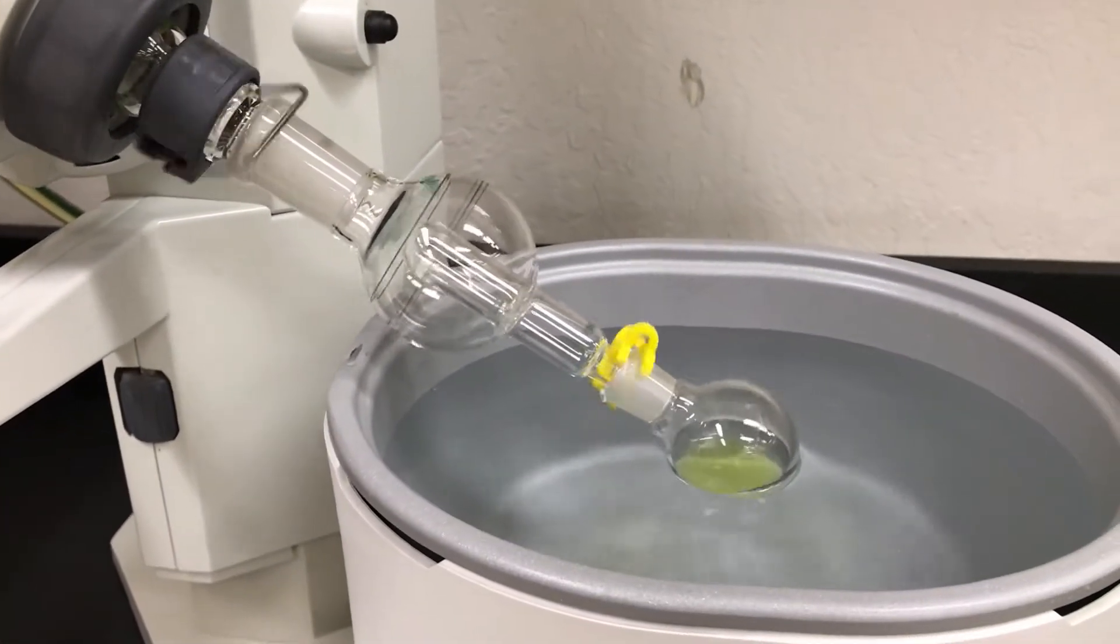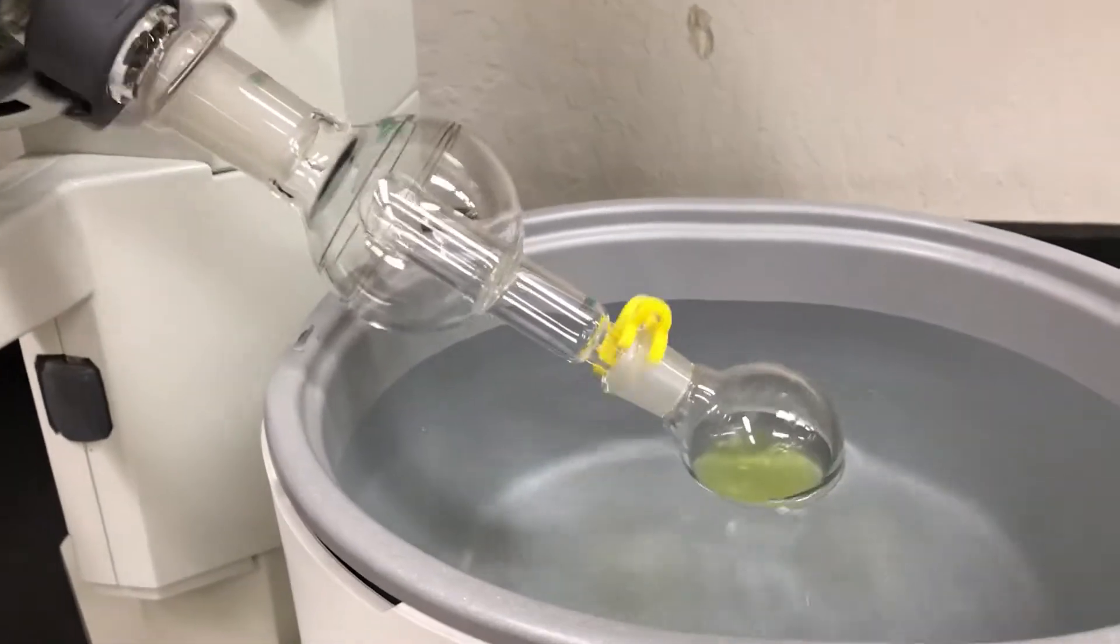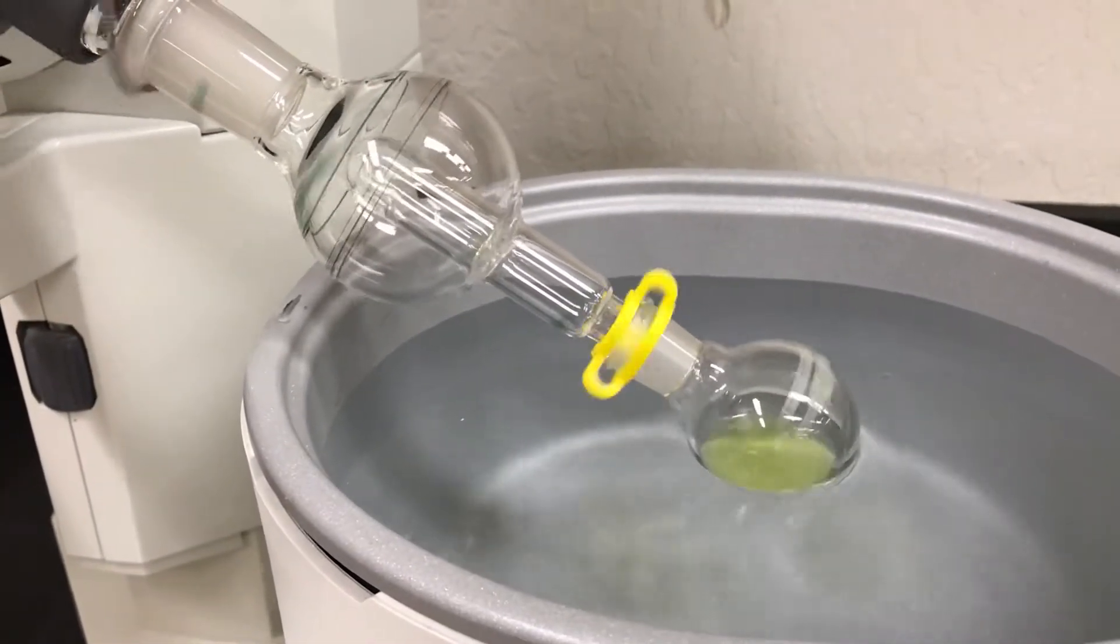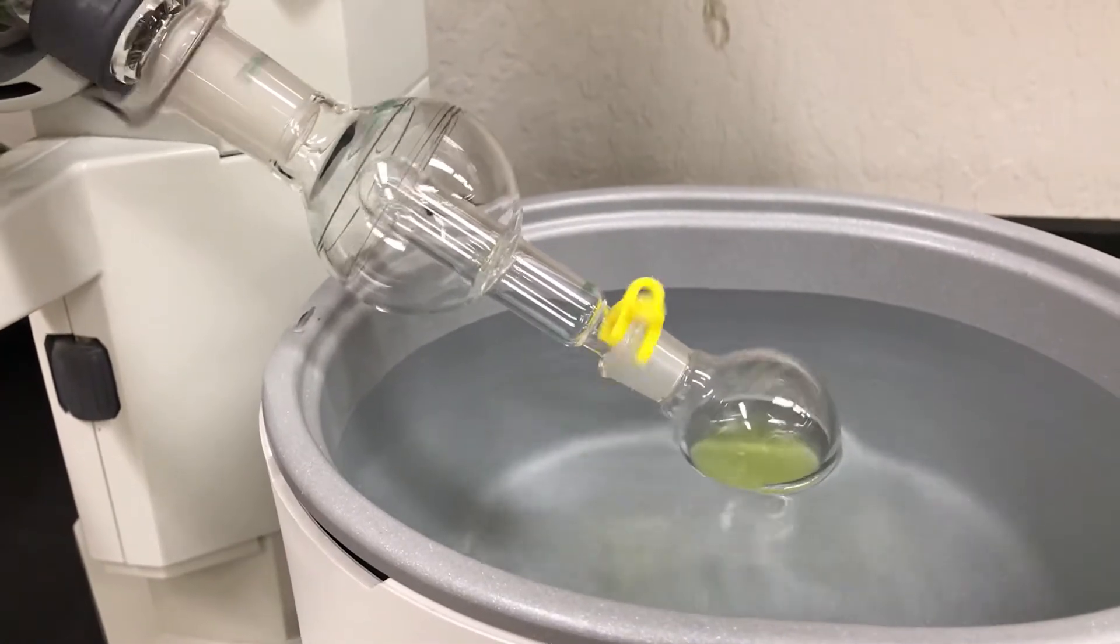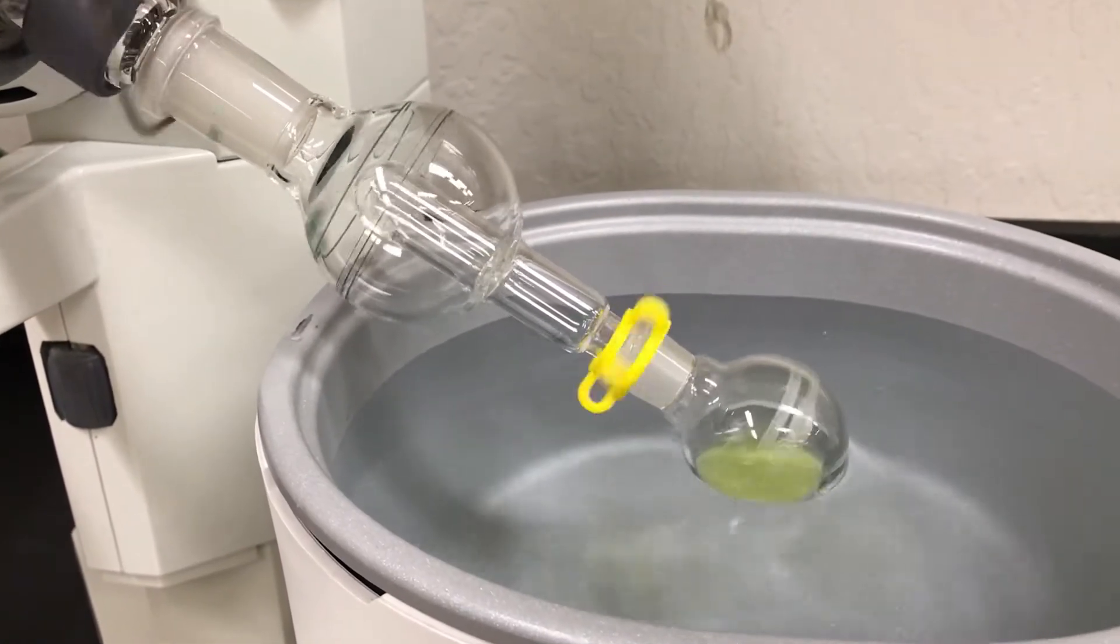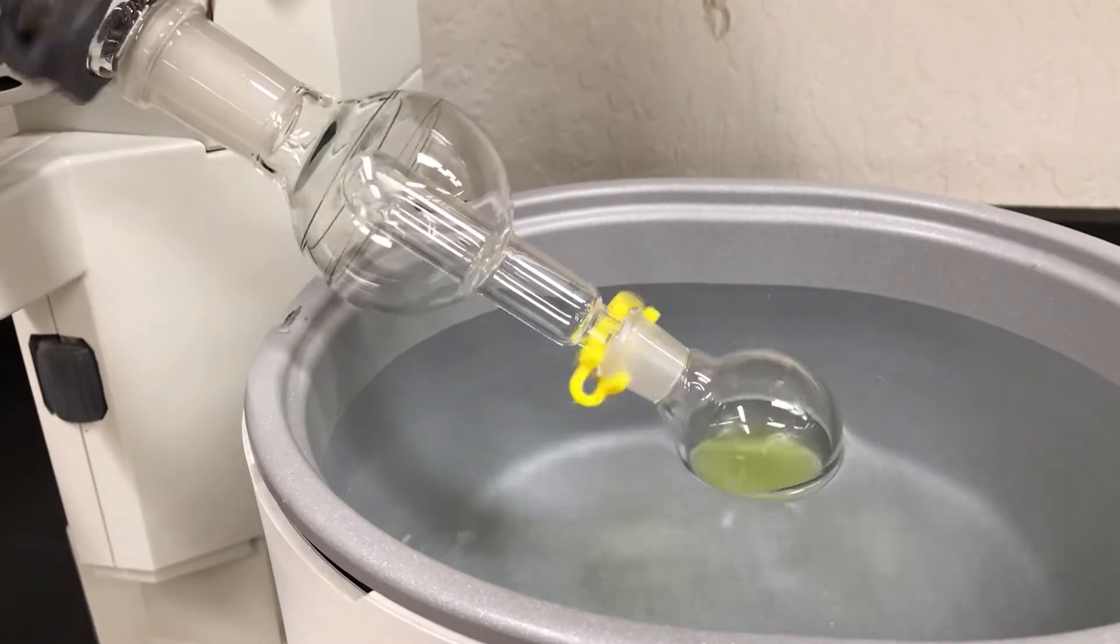At this point you then just wait for that solvent to evaporate. There's no set amount of time for this step. It depends on the boiling point of the solvent. It also depends on the temperature of the bath and how low your pressure is inside of the instrument.